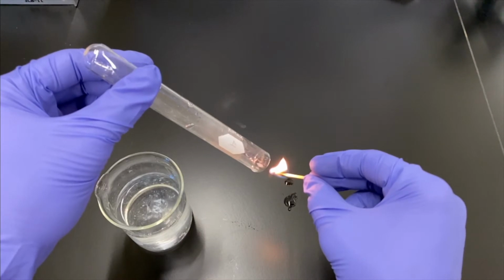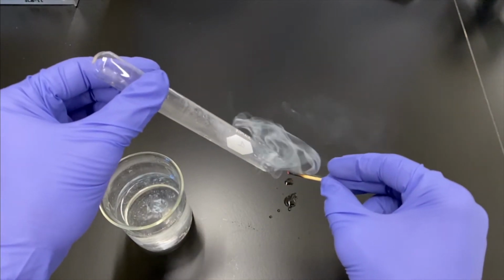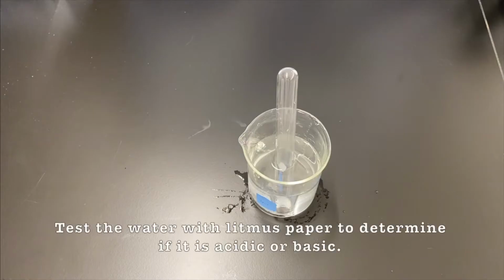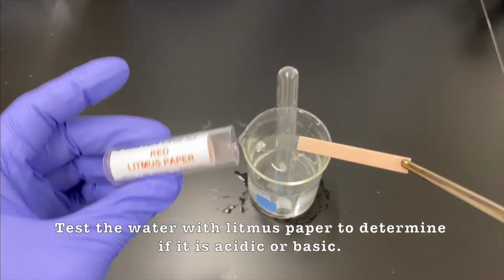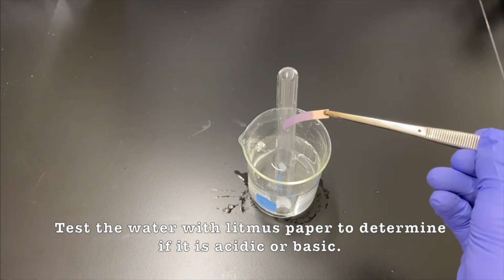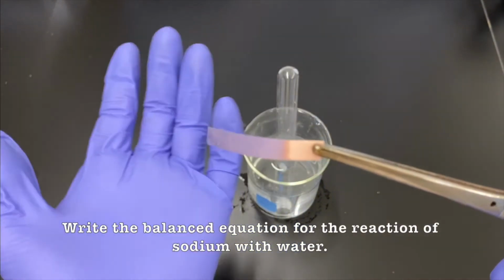And you can kind of see the gas sneaking out. Oh, it catches the flame, and that's beautiful. So yeah, definitely hydrogen gas. Again, we're going to test the water left behind and see if it's basic. And it's basic. It's blue. So again, we had hydrogen gas and hydroxide ions floating around.